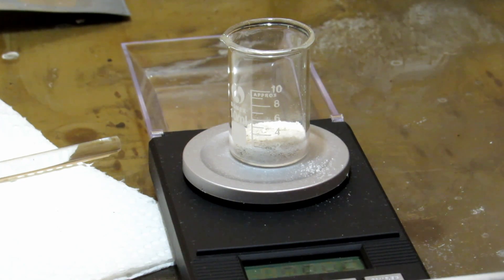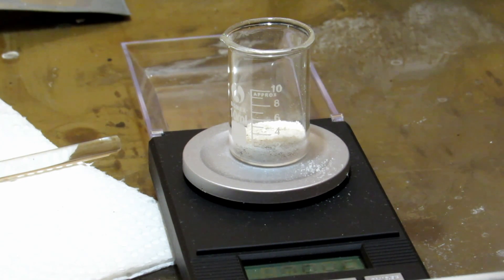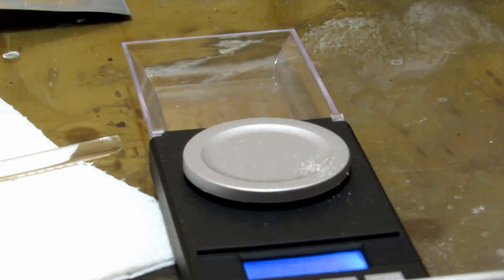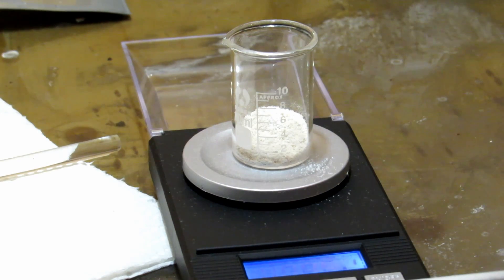There is certainly more than one gram of caffeine in all of that coffee. On average, one cup of coffee contains about 100 milligrams of caffeine. And with a kilogram of coffee, you can make way more than just 10 cups of coffee. But we still did successfully extract some very nice caffeine, as you can see right here. It's a nice powder, decently white. It might be a little bit impure, but it's still nice. I'm just glad that we actually extracted caffeine. I don't really have a use for it, so I'll probably just let it sit on my shelf.